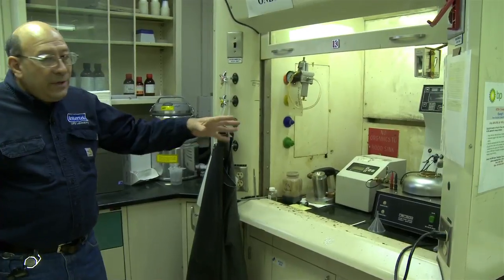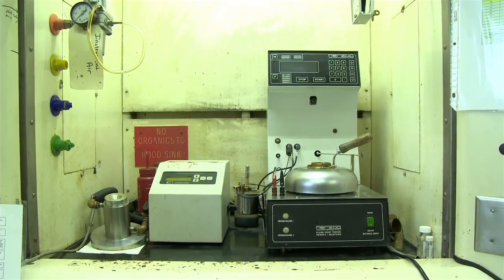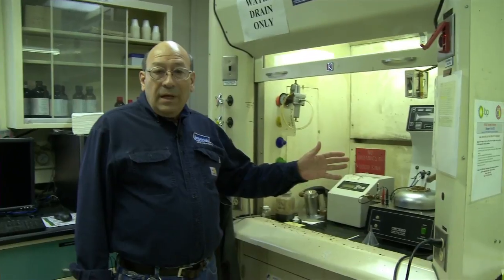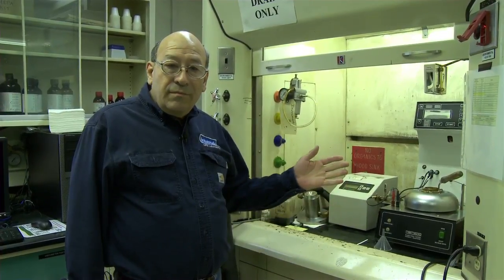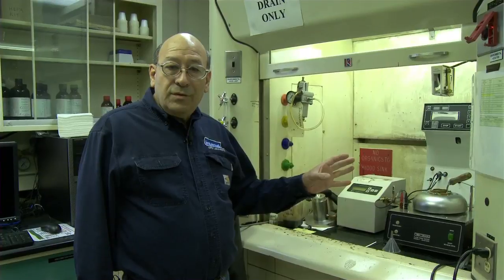In this area here, we do primarily flash points. Whenever there is a tank out at GCs or flow stations or wherever that needs cleaned out, and a super sucker is going to do the job, we make sure that the flash point is within a certain range and there's not any issue with volatile hydrocarbons igniting.